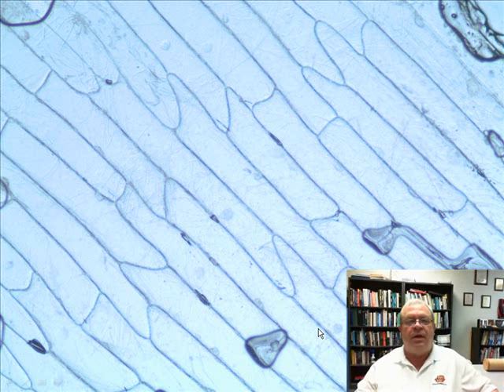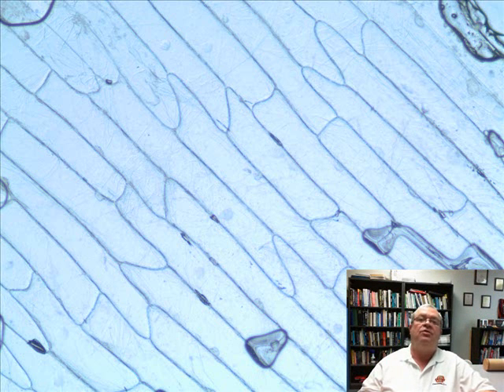We have some cells that you looked at in Lab 1. And so I'm going to prepare a number of these videos to help you prepare for your lab test and also for your lecture test as I ask questions about these various specimens. Let's start with this one.